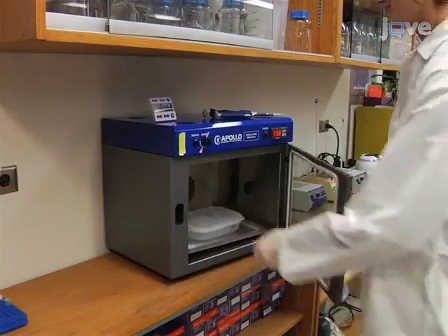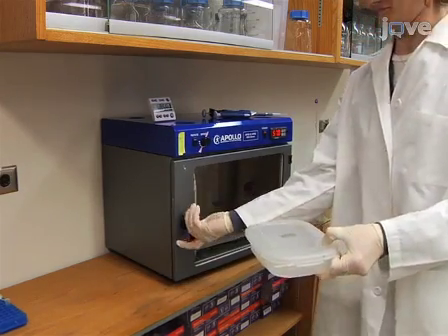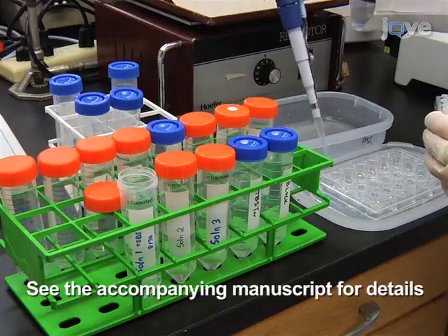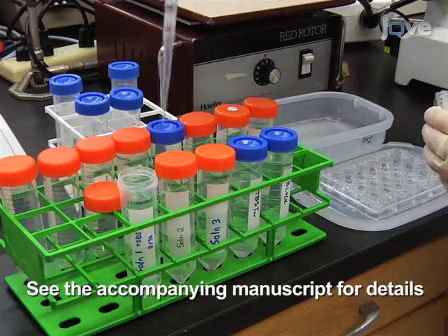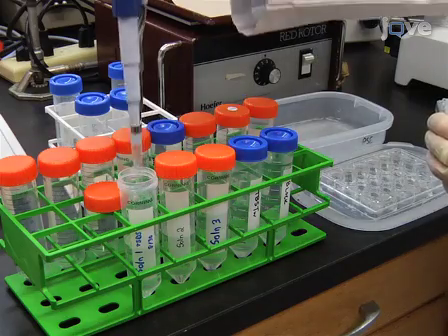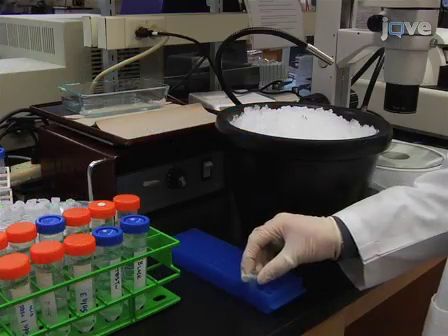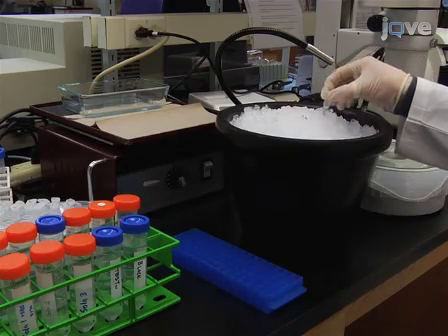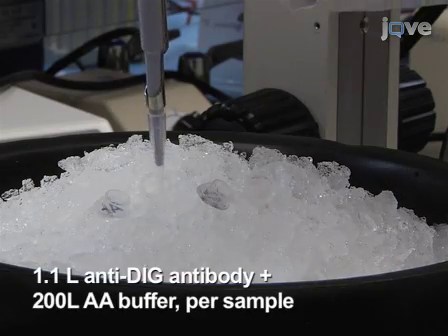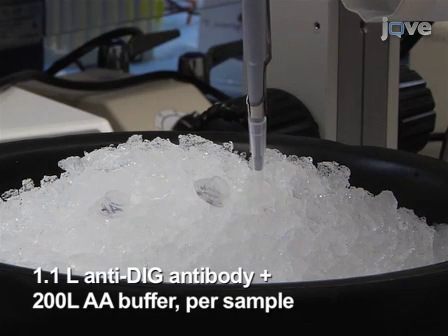The next day, wash tissues with solution 1, gradually changing to solution 2, then treat with RNase, then wash in solution 3, followed by washes in TBS-tween and tissue blocking buffer. While the tissues are incubating in tissue blocking buffer, begin a minimum 2 hour incubation of the anti-dig antibody in antibody absorption buffer at 4 degrees Celsius.